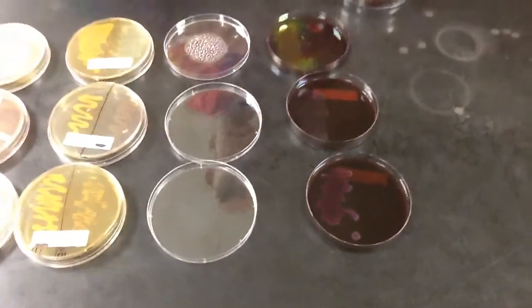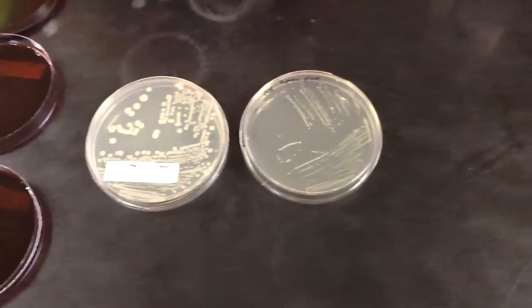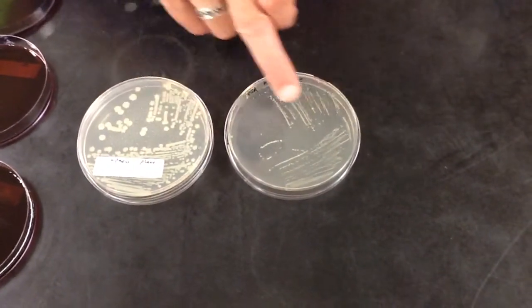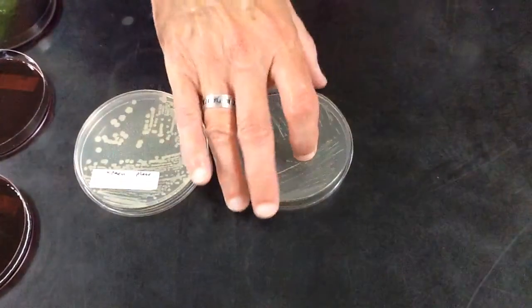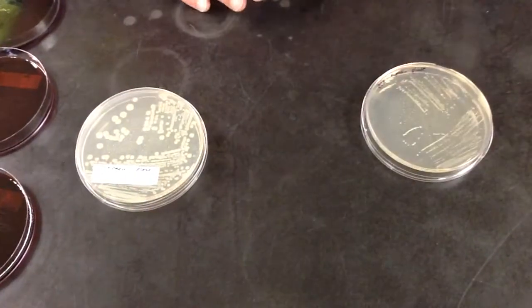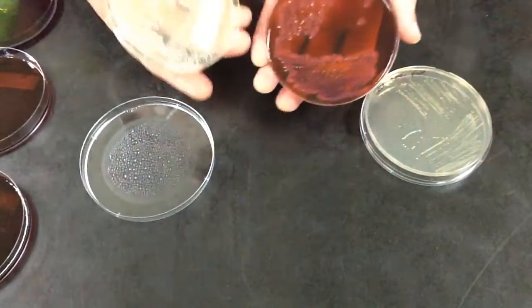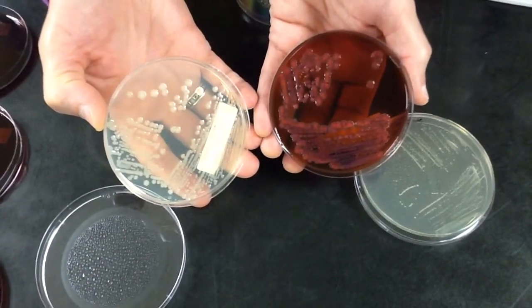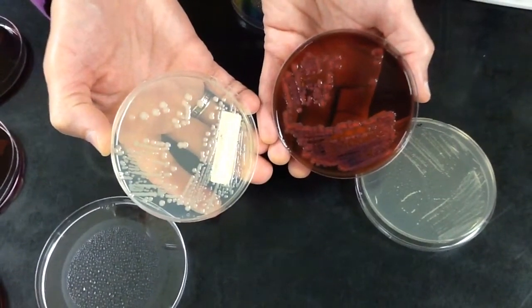One last thing I want to show you with the plating — because this is what you will do in class — is you're going to do a full streak plate. When you take a look at this, you can clearly see this is Klebsiella pneumoniae, which indicates a gram-negative bacteria. The other thing that's interesting — you can see that these colonies are very mucous-y, so colony morphology is extremely important when you do this type of testing.